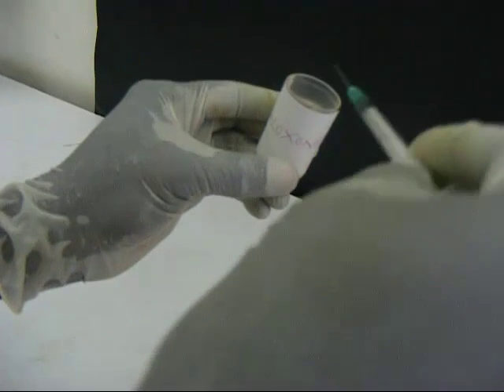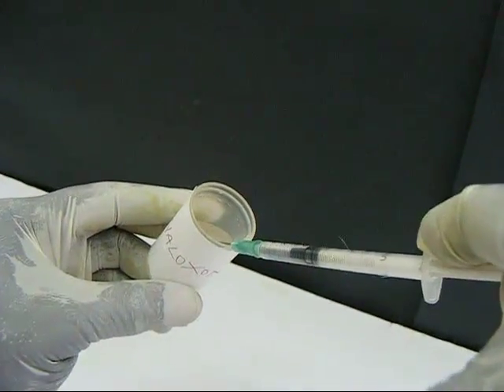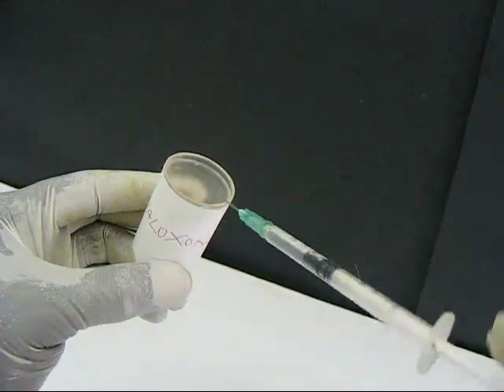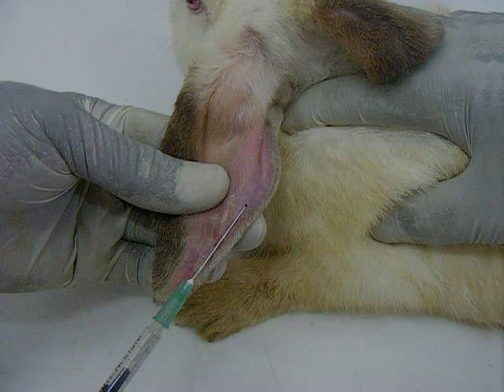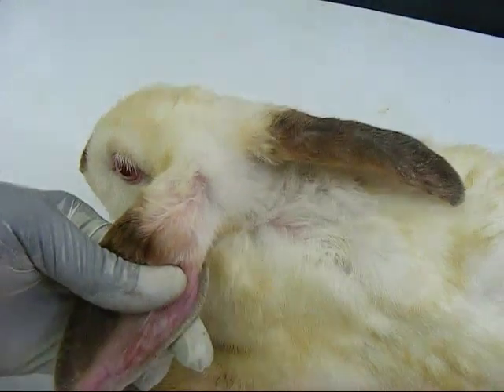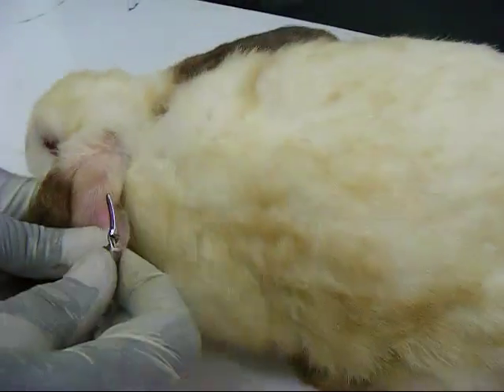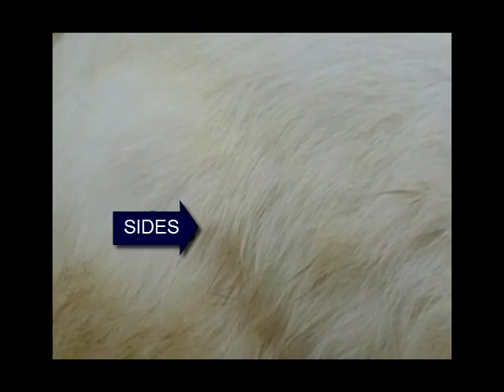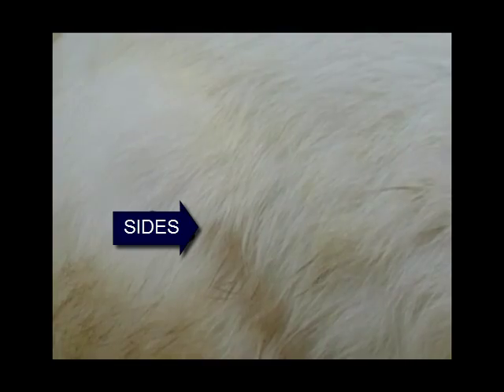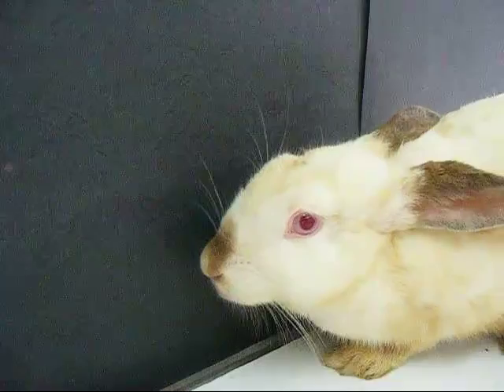The respiratory depressant effect of morphine is reversed by naloxone at a dose of 5 milligrams per kilogram. Observe the rabbit for respiratory signs and determine the respiratory rate after naloxone administration. Observe the pupil size again.